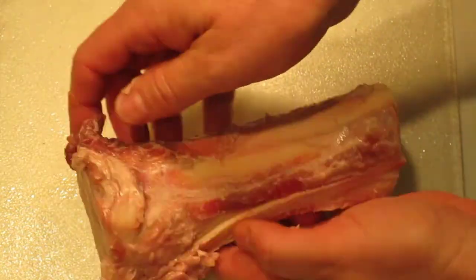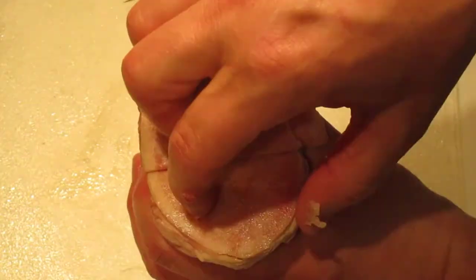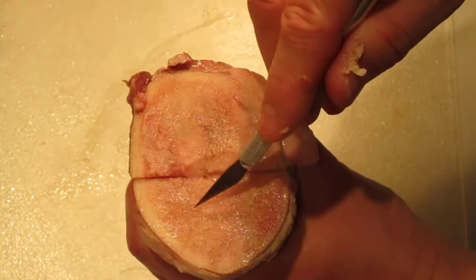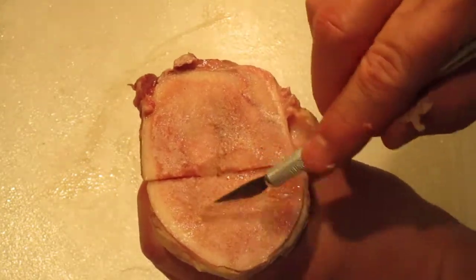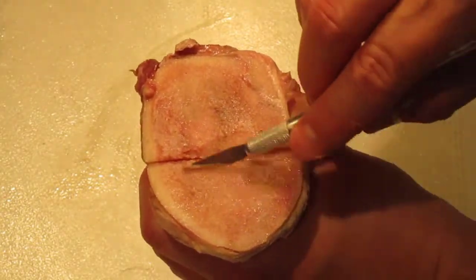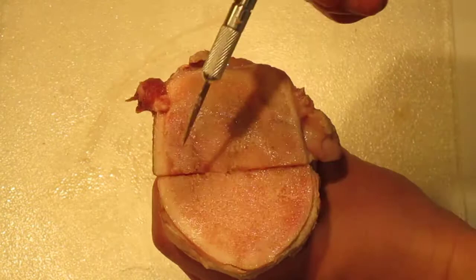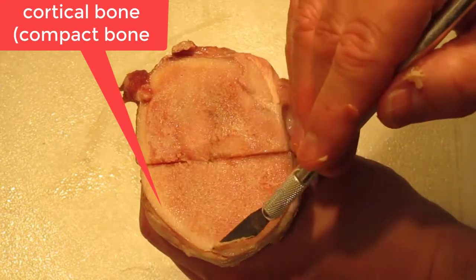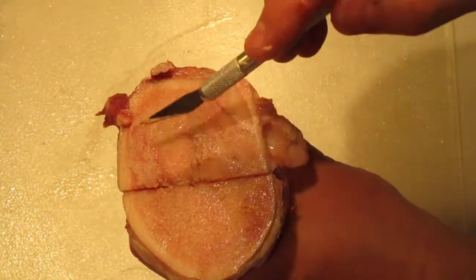Here is the cow bone, and on the end — the epiphysis — if I scrape across it you can hear that scraping as the scalpel goes across the spongy bone. I can actually scrape and get a little bit of stuff off there. Around the edge here you can see this lighter color — this is cortical bone, also called compact bone.